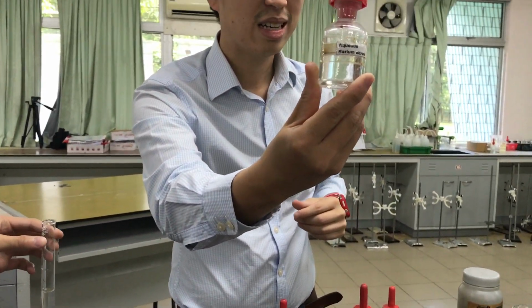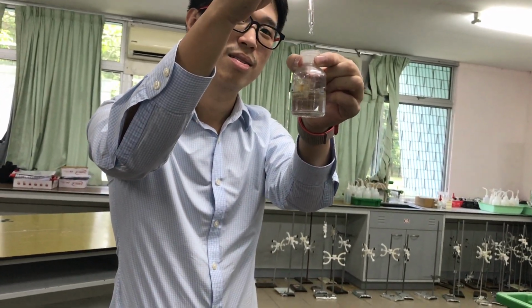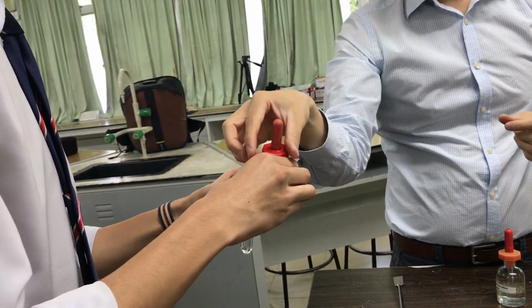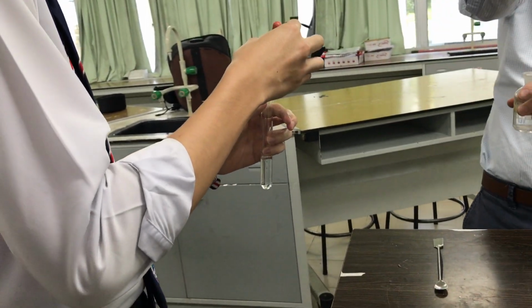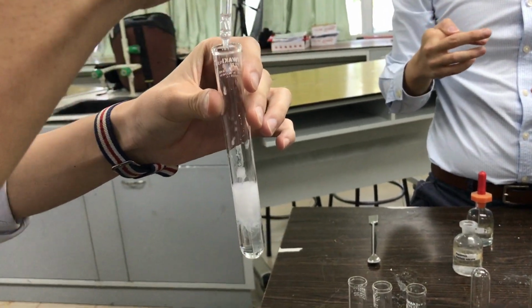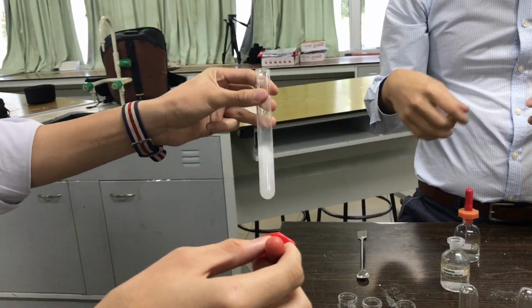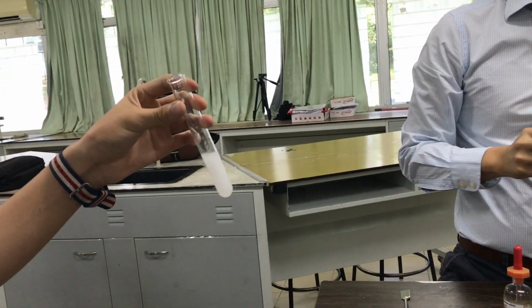Aqueous barium nitrate. What color is it? Is it solution or solid? Solution, okay? There you go. So just add a few drops. Okay. Make sure the camera catches you in action. Ah, you missed it. Sorry. You got it? Everyone see what happened? Okay, shake it. Shake it harder. Okay, what do you see? Is that the observation there?